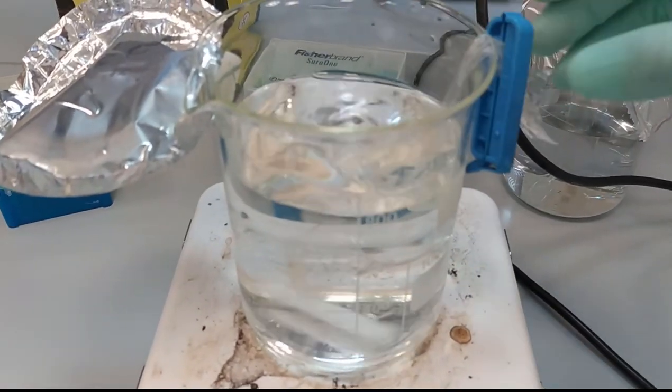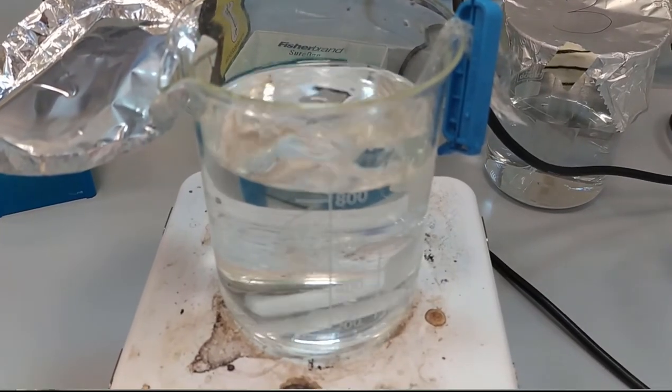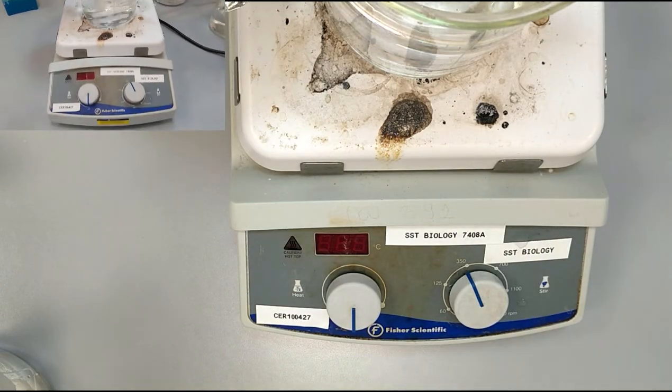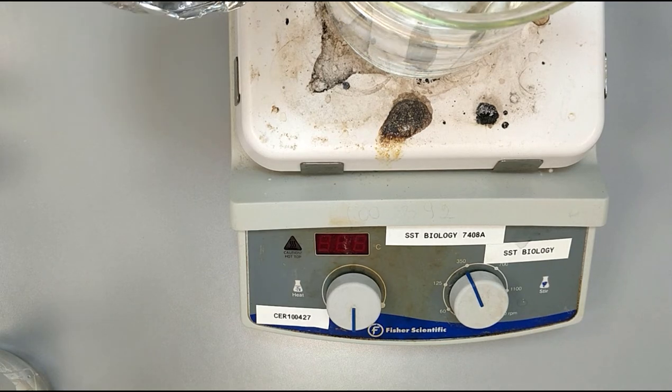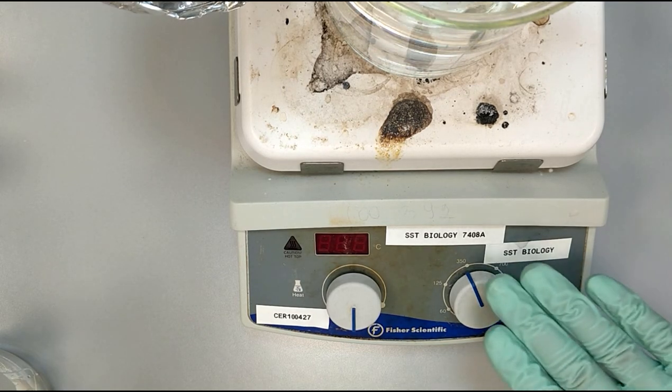And we can proceed to the next rotator. So each of these beakers will be mixed on such stirrers.